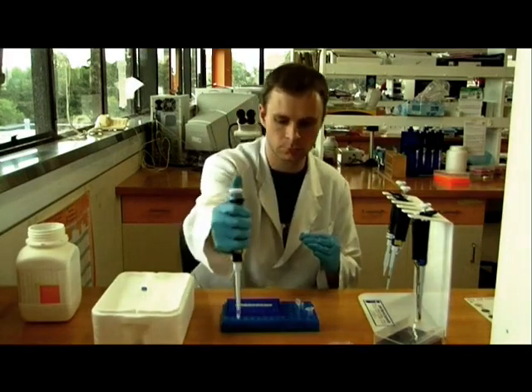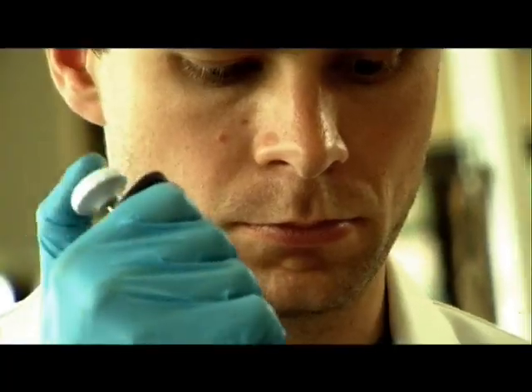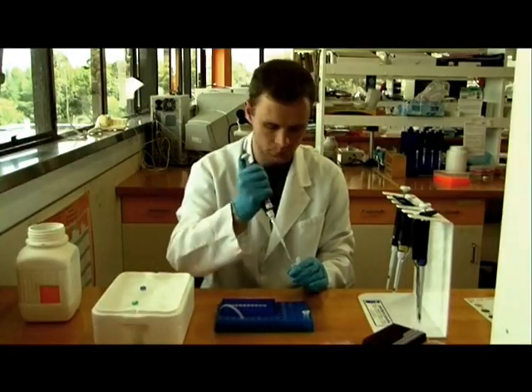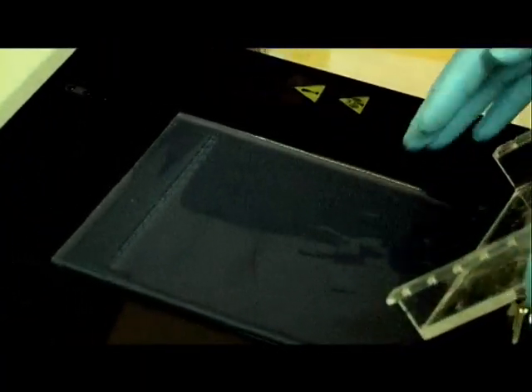We will now see how this restriction digestion works using PCR products from 6 weka. A master mix is made of HaeIII enzyme, buffer, and water. The buffer provides optimal chemical conditions for the HaeIII enzyme to work, and the water makes the solution up to the correct final concentration. The master mix is then distributed across the 6 weka DNA samples. HaeIII works most efficiently at 37 degrees centigrade, and will take about 55 minutes to completely digest the PCR products. When this is done, we will perform gel electrophoresis on the digested PCR products and visualize the results.